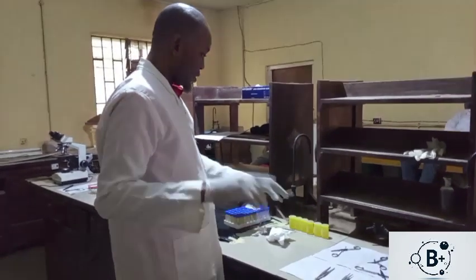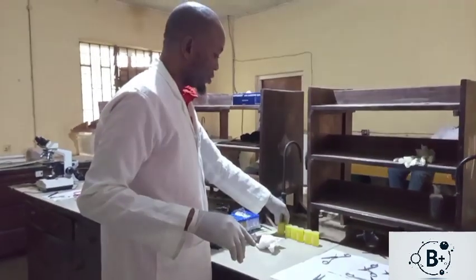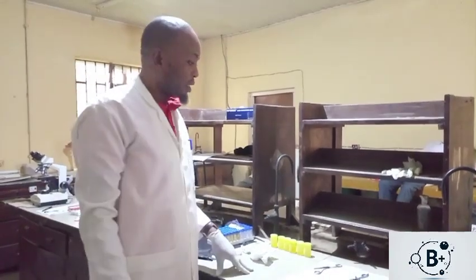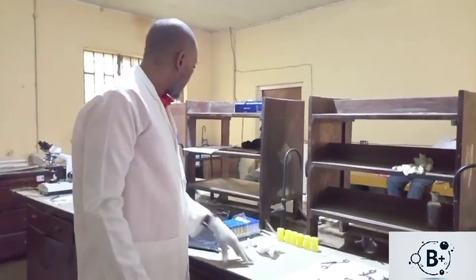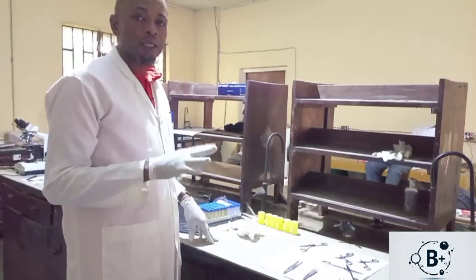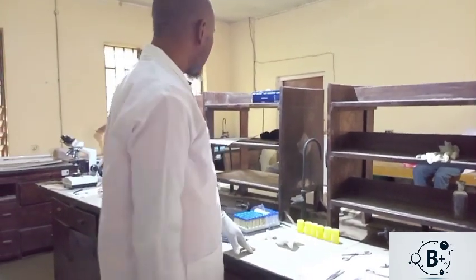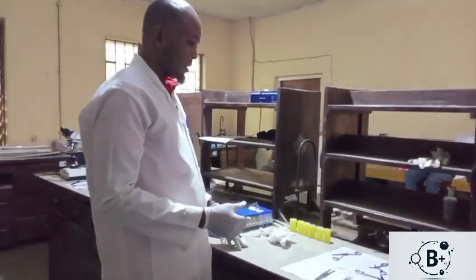So for each group in this experiment, we have 6 groups, control inclusive. Then we test for different treatments. Especially, we use ethylene glycol monoethyl ether. That is the main treatment. Then as a counter, we use a therapeutic treatment. The therapeutic treatment is chlorogenic acid, a phytochemical obtainable from most plant species. So we've been able to check the effect.